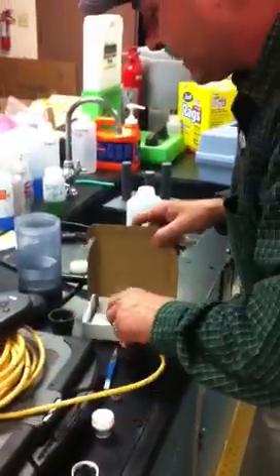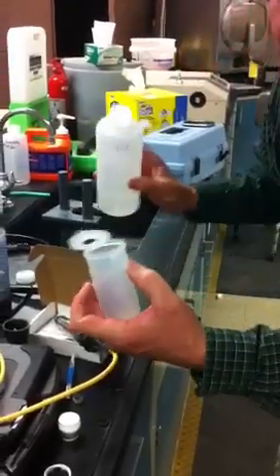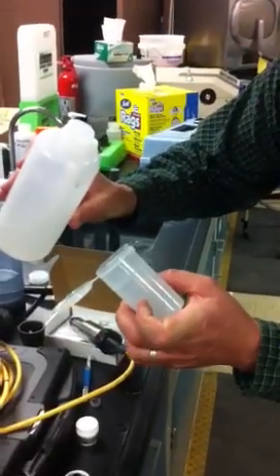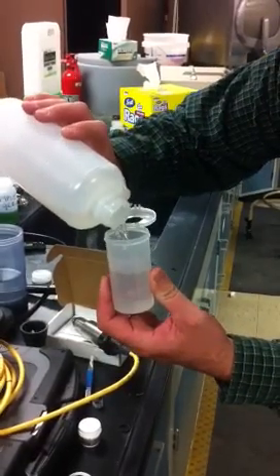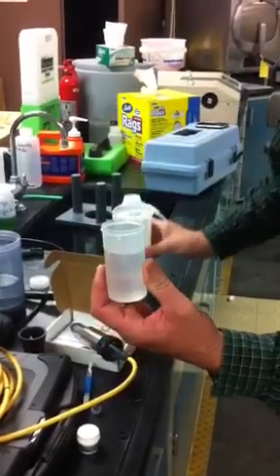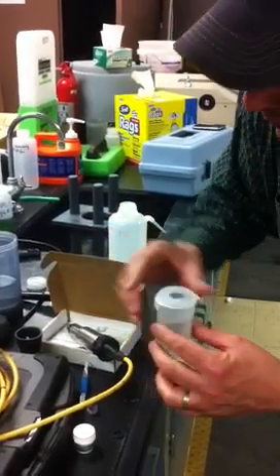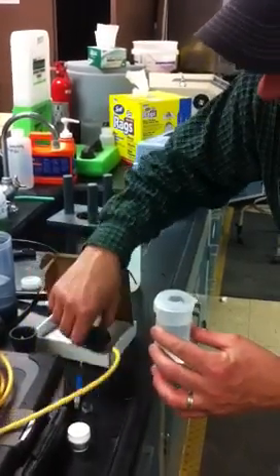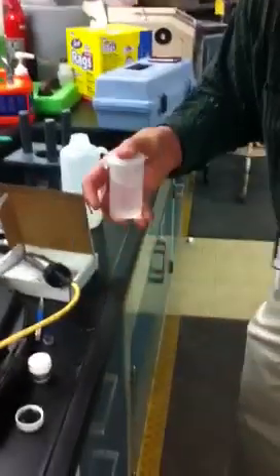Next thing you do is you have your calibration cup. Fill it with room temperature water about to that first line. It looks to me like it's about 90 milliliters. I'm sorry. Fill it to the first line because you're doing saturated air. The water should not touch the top of the probe. Shake it up with your finger over the hole for 1 minute.